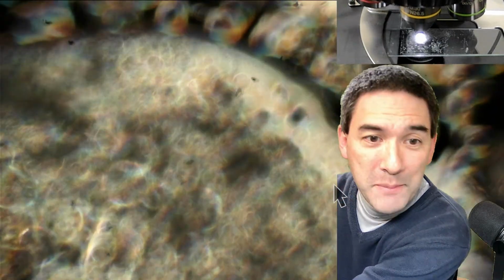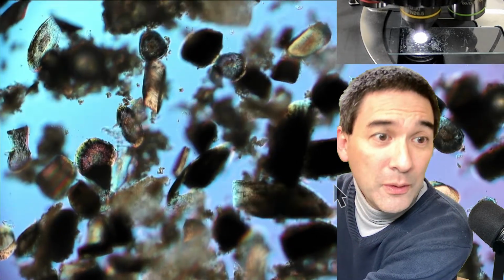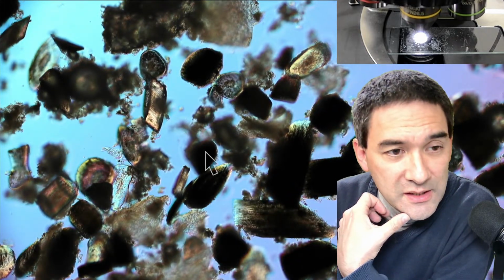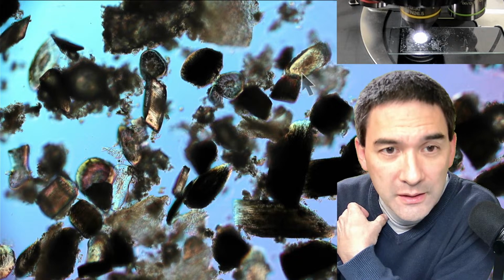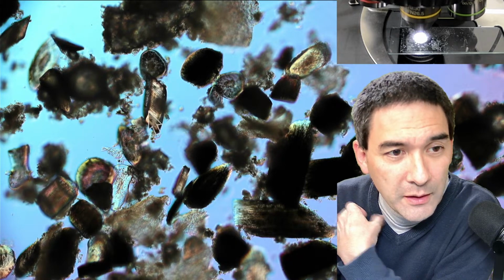Okay, so let's do the following, because there was this comment of a beard second, and somebody please do the math for me. Let's do this a little bit like this again, so that we see it a little bit better. I want to measure now. Oh, beautiful! Very nice. Look, I'm going to show you something. We are very lucky. Do you see this here? Over here, this beard is right on its edge, right on the side. This is seen from looking into the beard, that's the so-called medulla, the central part. And here we're lucky that this is seen from the side.